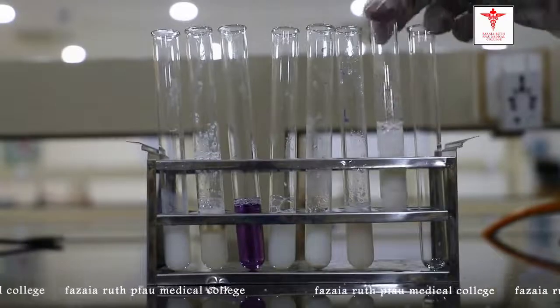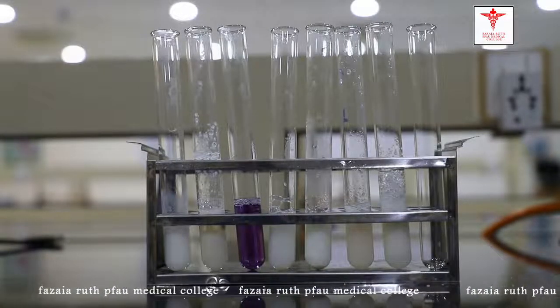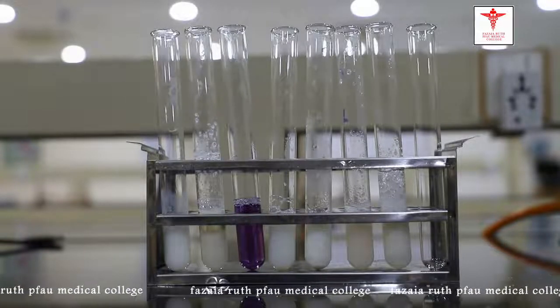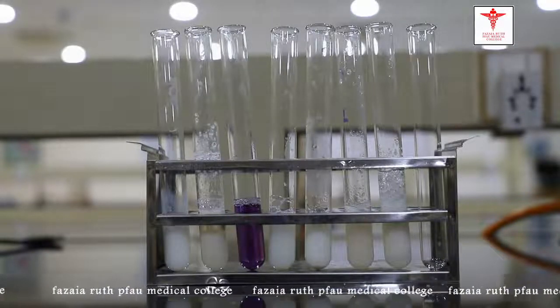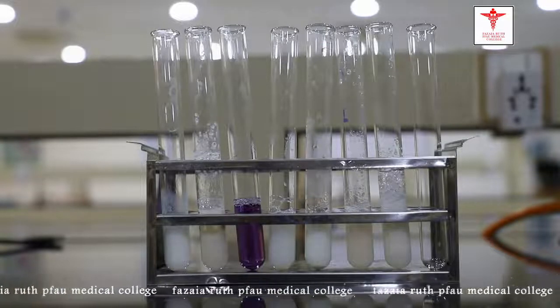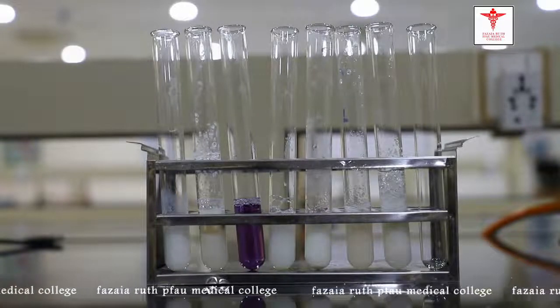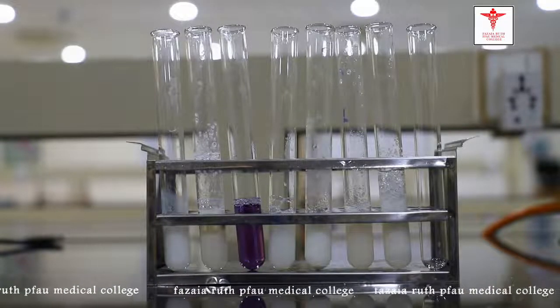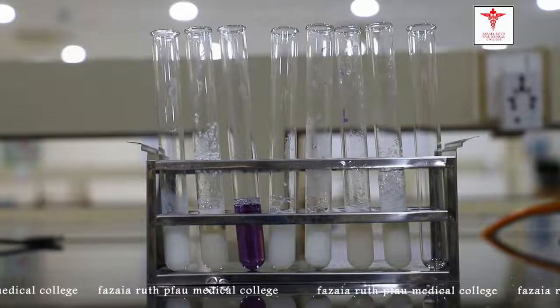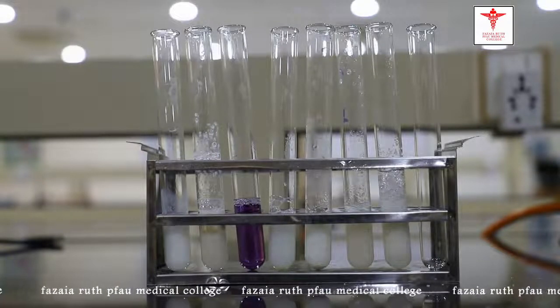We are done with the basic tests for general proteins and individual proteins. Some of them have confirmatory tests — we didn't perform all of them; for example, we didn't perform Neumann's test for casein as some reagents were unavailable. For globulin and albumin, if we want to confirm, we can follow the Biuret test for that.